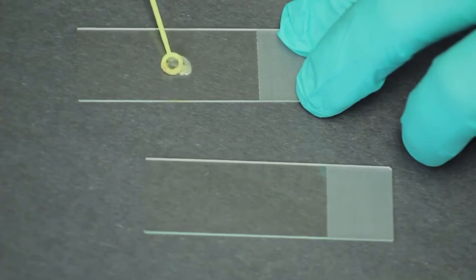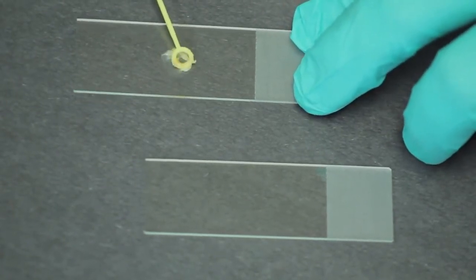You're going to take a large portion of your bacteria from a BHI plate. Solid culture will work much better than a liquid culture for this.